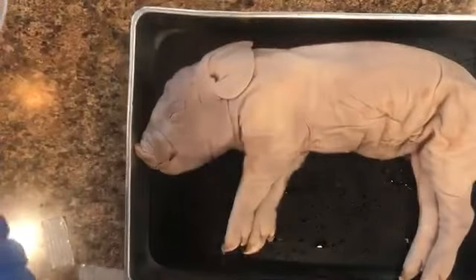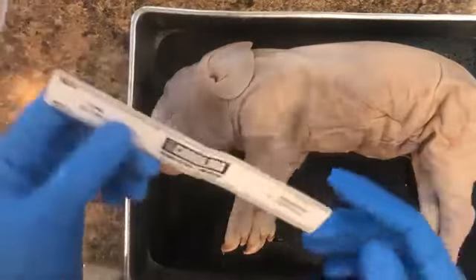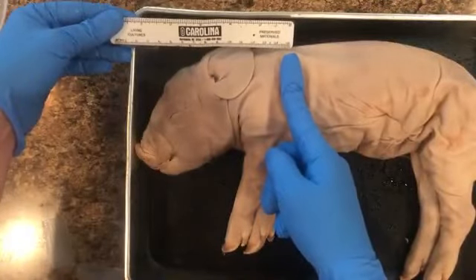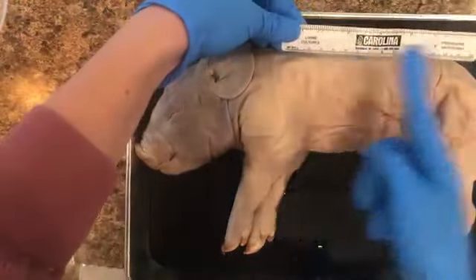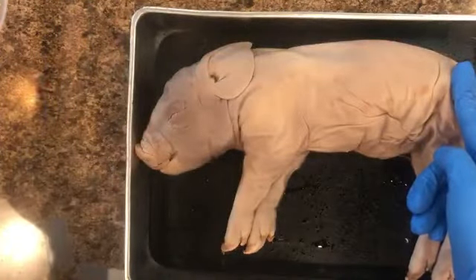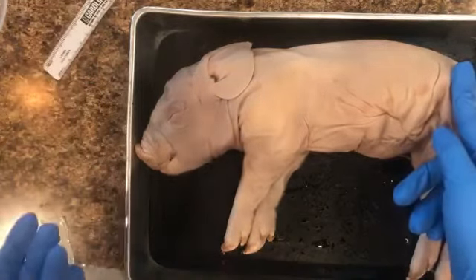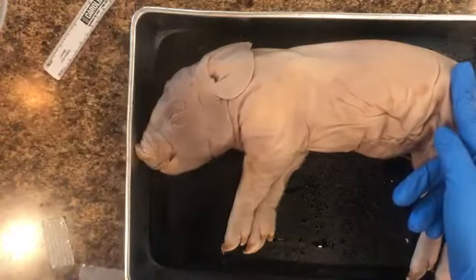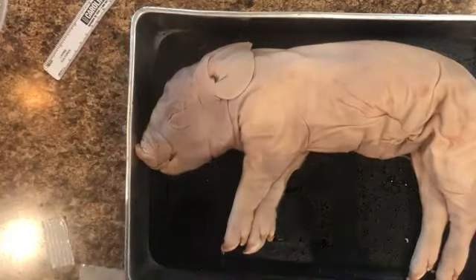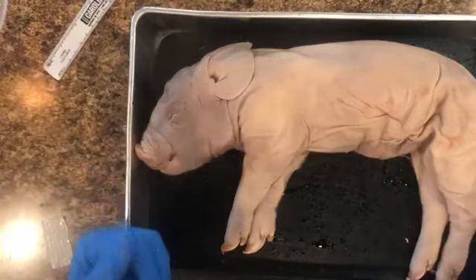Something else I just kind of want to bring up, if we were to measure the length of it, my ruler only goes to 15 centimeters, but if this here is from nose to top of the trunk here, here's 15 centimeters, here's 15 centimeters, so it is well over 30 centimeters. I have a little chart I'm going to show you, and it tells you the age of the fetus in days. Since this one is over 300 millimeters or 30 centimeters, it is considered full term, meaning it is 112 to 115 days plus in the uterus. This is a full term fetal pig.